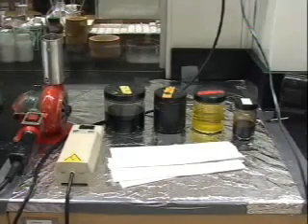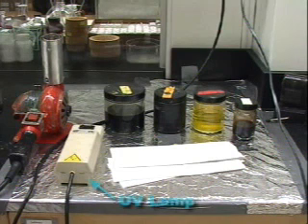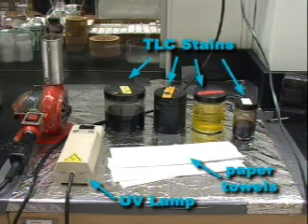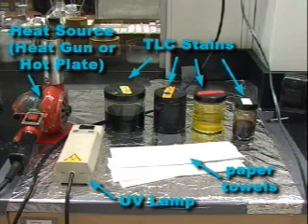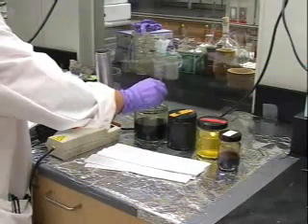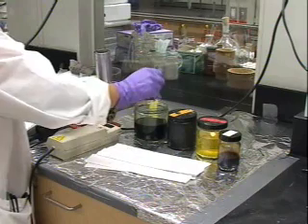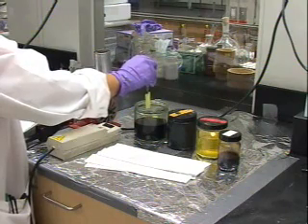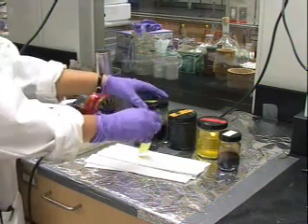A standard TLC station in an organic laboratory consists of a UV lamp, which you learned about in the basic video, a variety of TLC stains, some paper towels, and a heat source, either a heat gun or a hot plate. Before you do any staining, spot and develop your plate as usual, and allow all of the solvent to evaporate from the surface. Then, dip your plate into the stain. Allow excess stain to drain back into the jar, and dry the back of the plate on a paper towel.